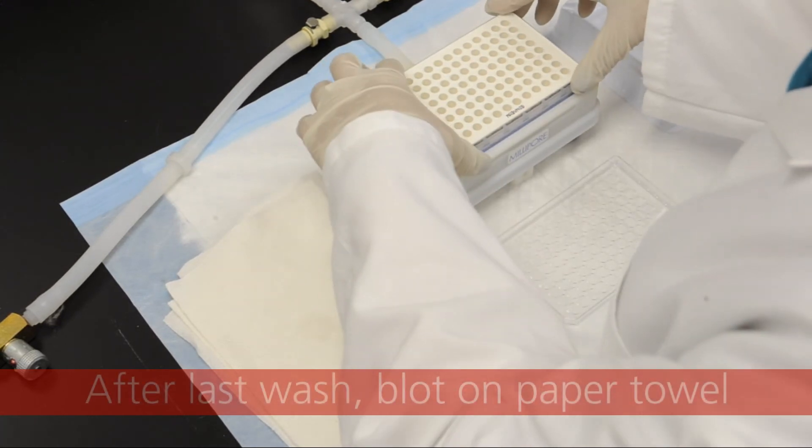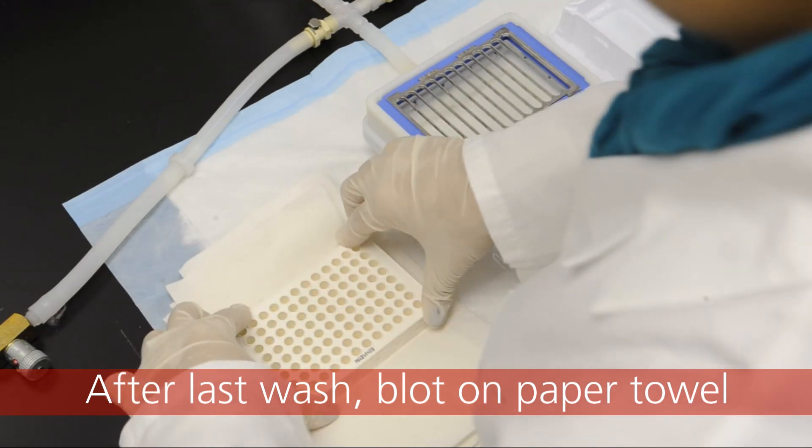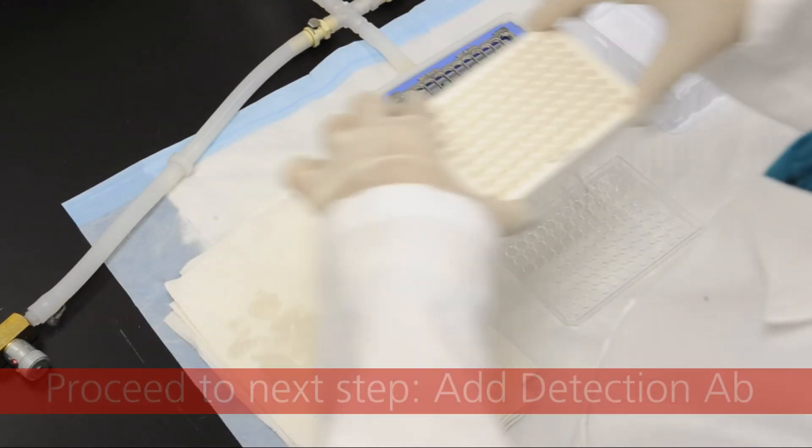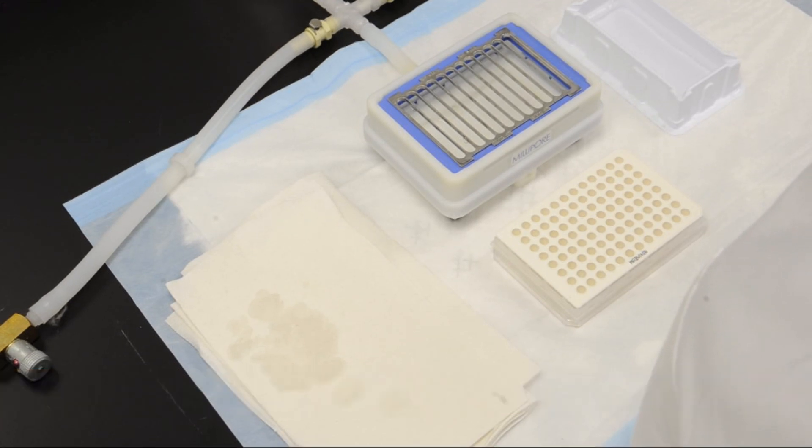After this last wash, blot the bottom of the filter plate with paper towels. Proceed to the next step by adding the biotinylated detection antibody to the wells followed by shaking at 500 RPM at room temperature to incubate.